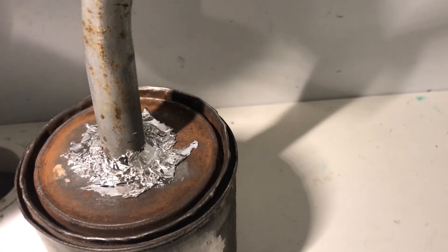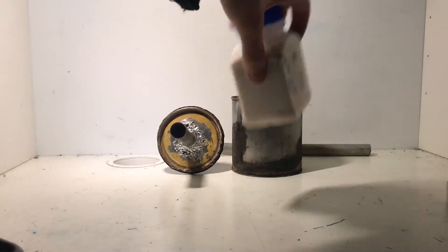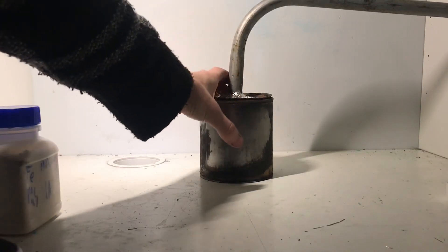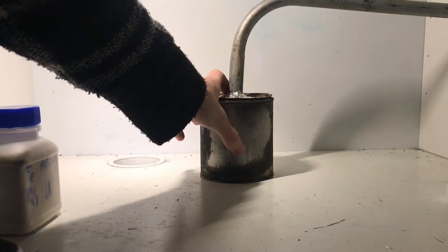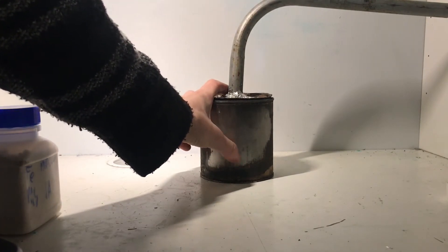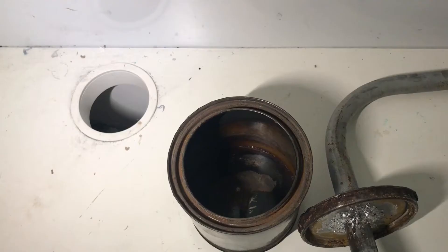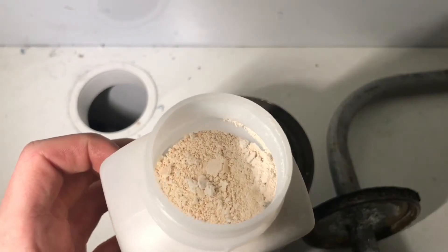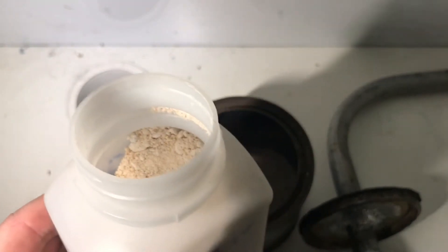Hopefully it doesn't leak or just doesn't work for some reason. I will just be putting the calcium acetate in here. What should happen is it should make acetone vapors that will condense, and we will be left with calcium carbonate in the can, and on the end is our acetone. It's very impure — very pinkish, probably because of iron, and there's also probably a lot of magnesium in it, because this came from an actual rock I found.